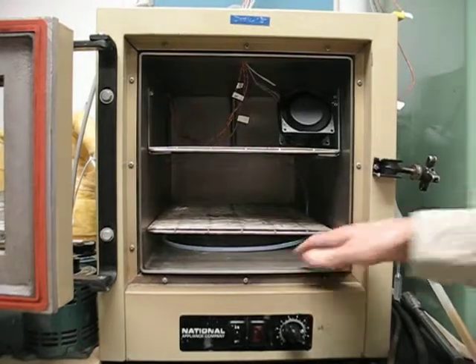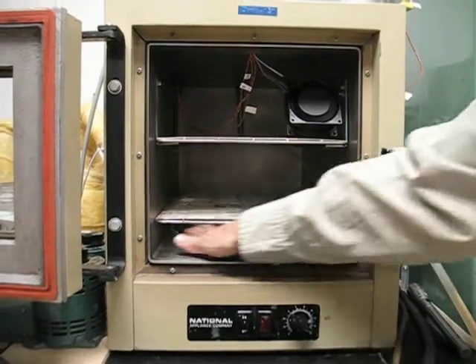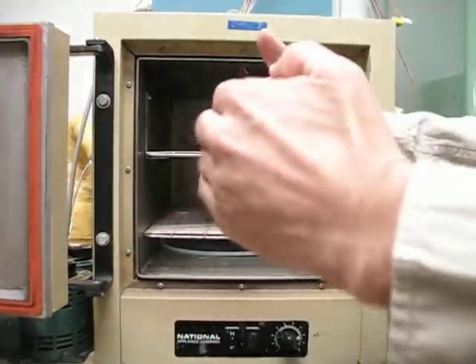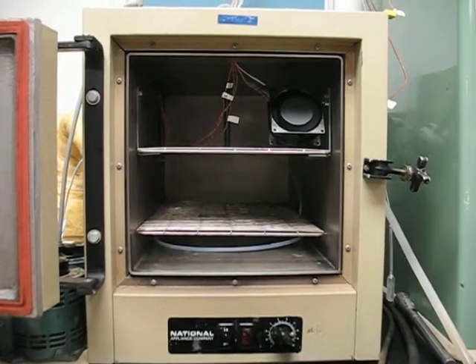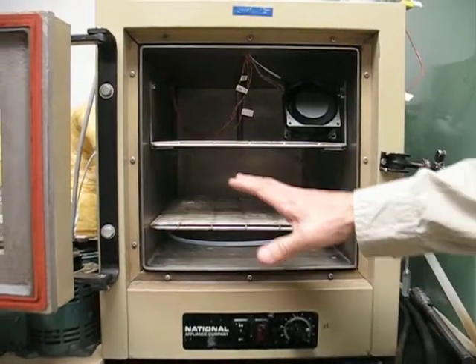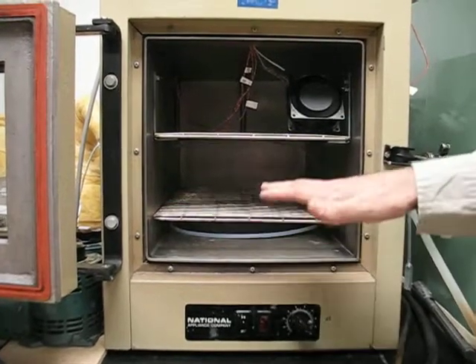In other words, there's not significantly more flow on this end as there is on this end because of the loop design. It goes into a T and it's going out like that, not just going to an end, which would tend to produce more flow out of the initial ones. And again, that's not even terribly critical, I don't think, but it's good to start out with that evenly.